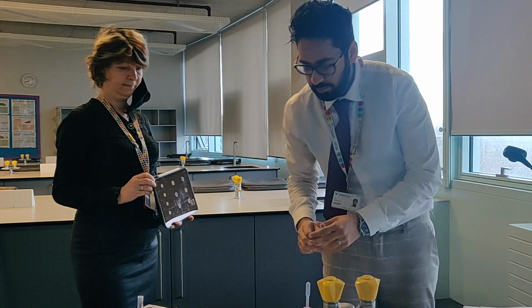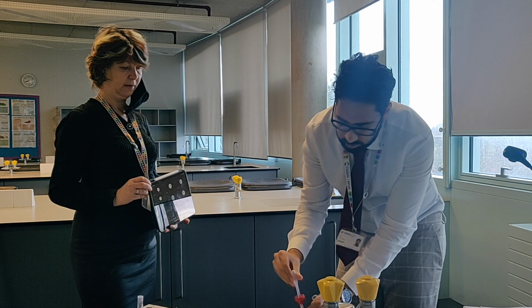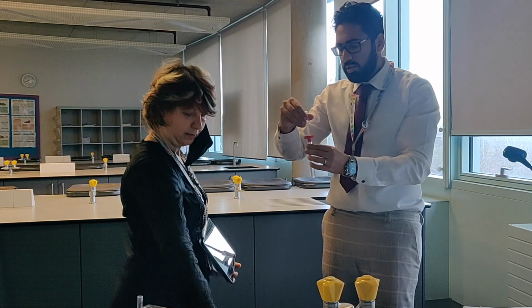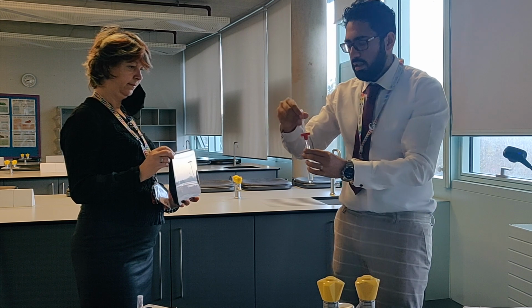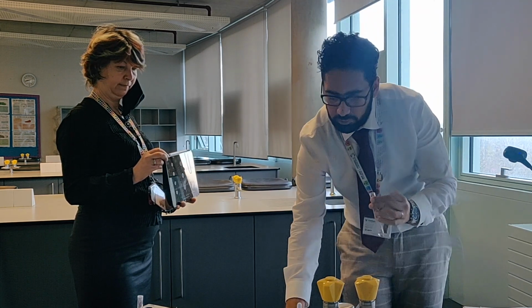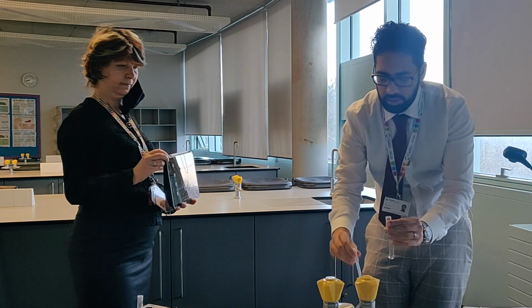Going to get a test tube. 10 drops, 1, 2, 3, 4, 5, 6, 7, 8, 9, 10. And again, 10 drops of sodium hydroxide, approximately.